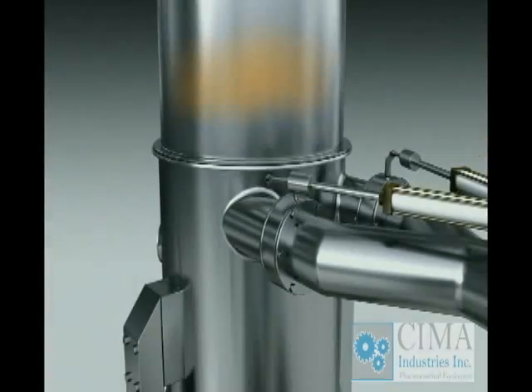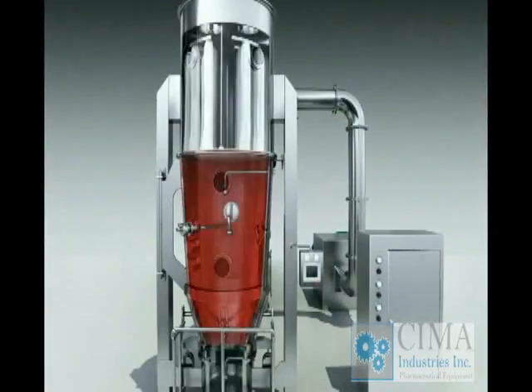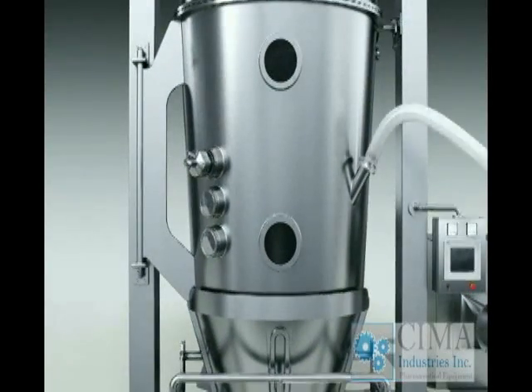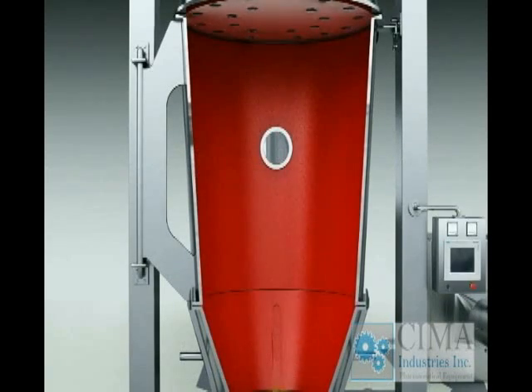1. Please consider the layout of the explosion release ducts for explosion-proof type. 2. WIP system is available on request. 3. Vacuum feeding arrangements are available on request. 4. Integration of top spray granulation, bottom spray coating, also known as Wurster insert, and tangent spray for pellet making are available on request.